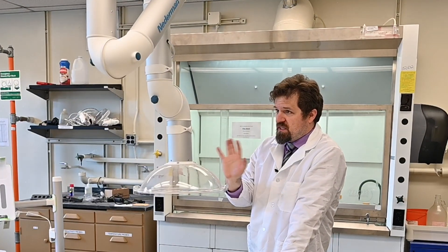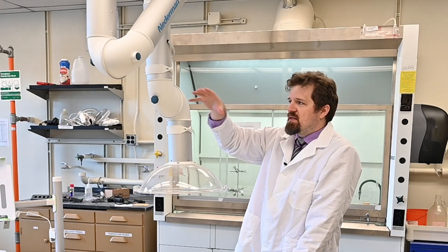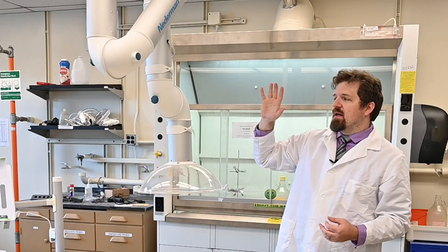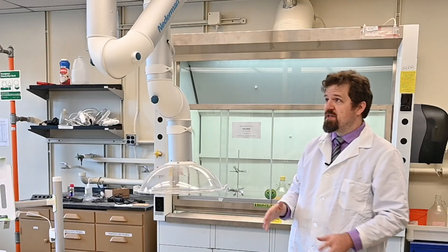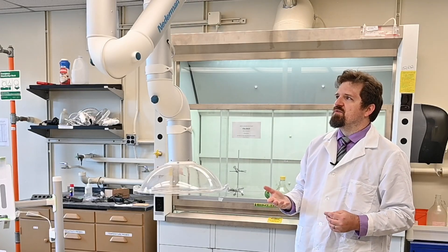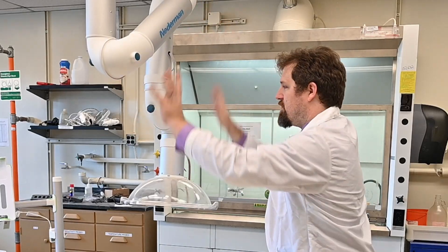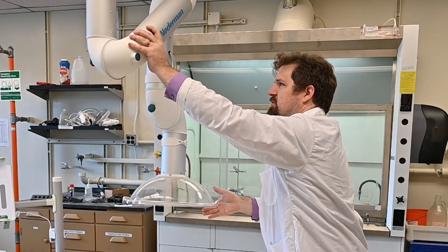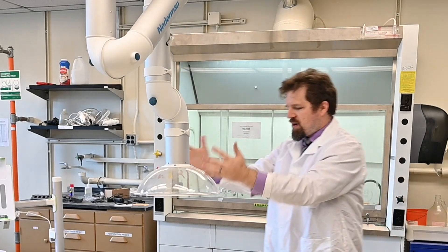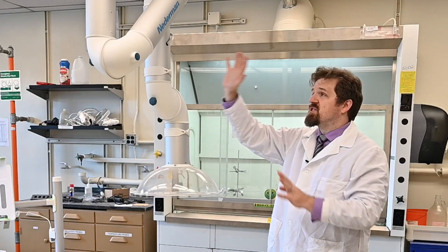Some of you keen-eyed observers may notice this device in the background — it's called a snorkel. It acts like a fume hood and creates suction that draws fumes up and out the top. If you're lucky enough to be at a school with this, congratulations — that's awesome. Most high schools and middle schools won't have one, but some universities will. They're fantastic because they're manipulatable — you can change the position of the joints, and there's a little on/off lever on the side. You can bring it all the way down to the table and work without the limitations of a fixed fume hood.